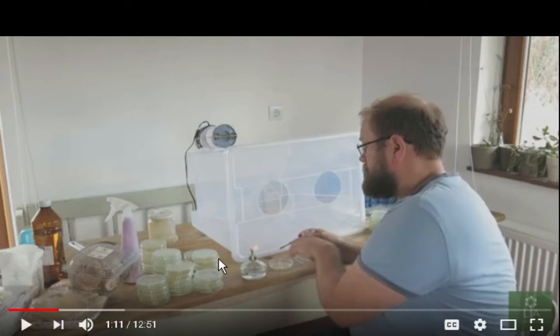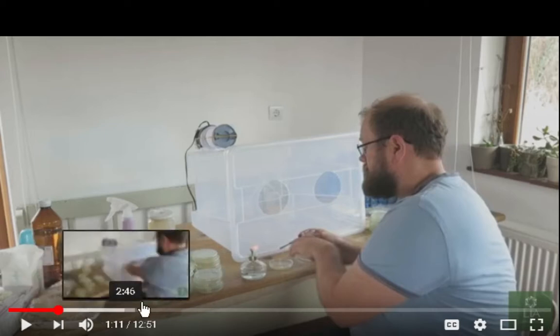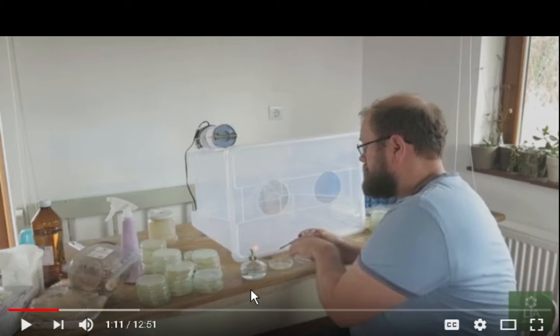Now, see, this is another thing that really bothers me, is that he's got all this alcohol smell, and he's got this flame burner just sitting right there. That's why I was opting for a completely enclosed container, so that you do not smell the alcohol anywhere. Hopefully, making the flame area a lot safer. Maybe I could even have some kind of a slightly enclosed container for that too. That makes me nervous.